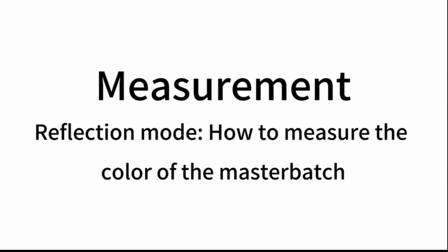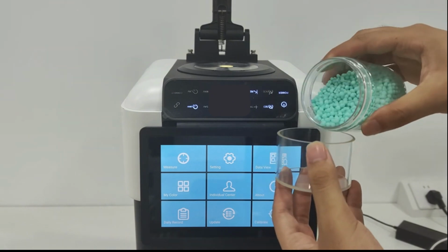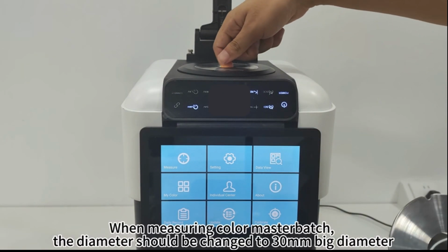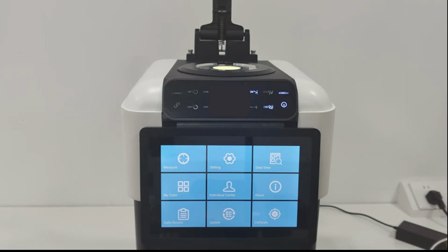Measurement, reflection mode. How to measure the color of the master batch. Pour the color master batch into a circular cuvette. Try to fill it up. When measuring color master batch, the diameter should be changed to 30 mm big diameter.